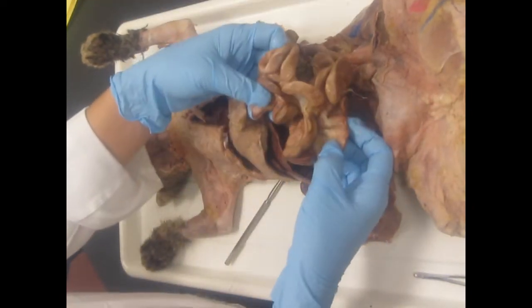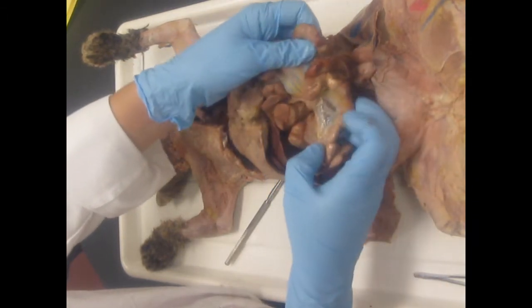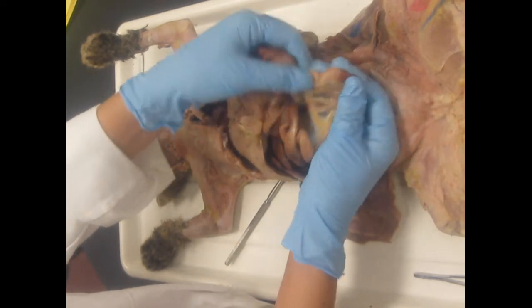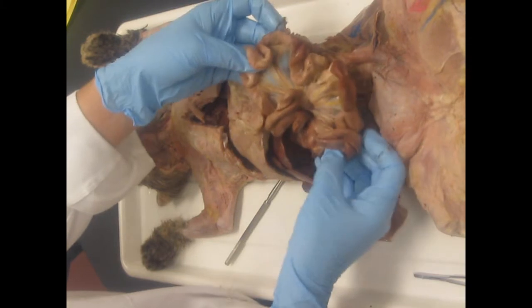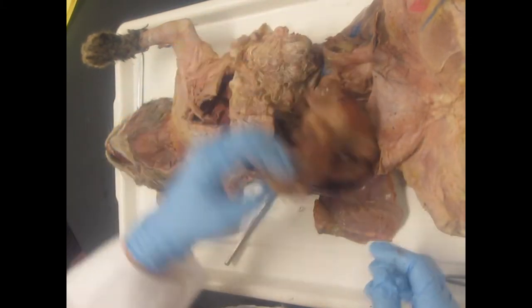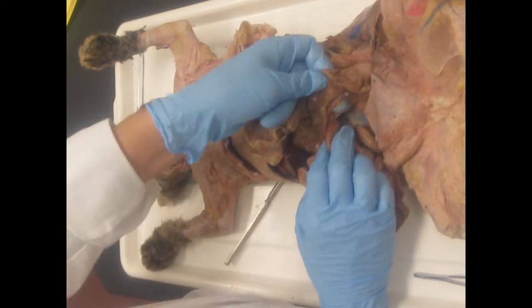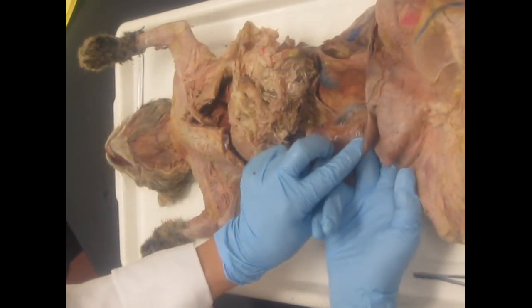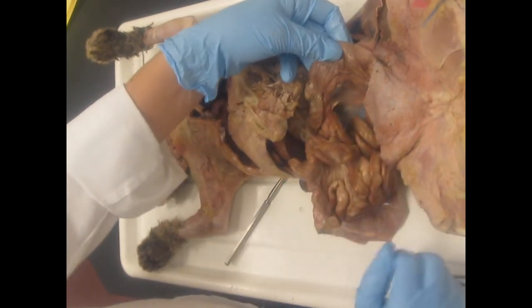These are the small intestines, and if you just kind of gently unravel them and open them up, you can see that these membranous structures are holding that intestine to the back of the body wall, mesentery. Then you find the colon, which is along the back of the body wall here. And if you lift that up, you have mesocolon. You can see my finger behind there. Okay, and that's tethering the colon to the back of the body wall, mesocolon.